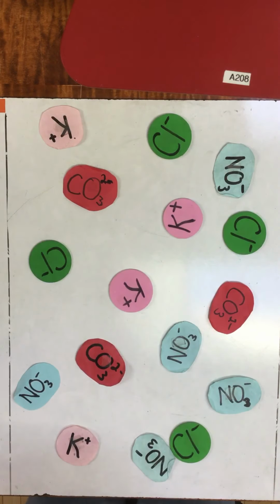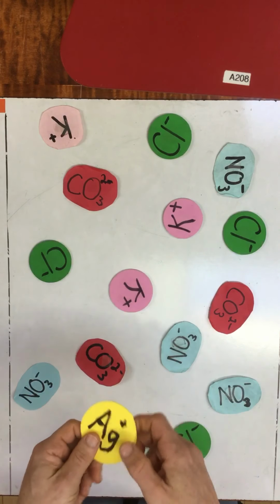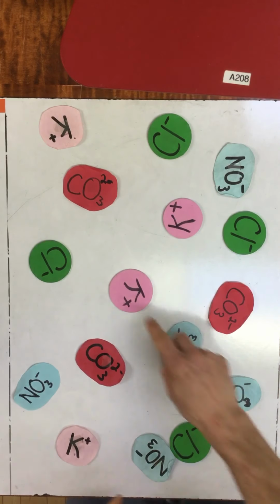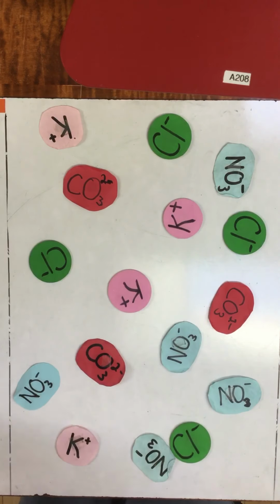So even though we added some additional ions, the chlorides and carbonates are still floating around because we can't make any precipitates. So you've seen one example that works, which was the barium ions that only make the carbonate precipitate. You saw silver not work because it precipitates with both the chloride and the carbonate. And you saw potassium not work because it doesn't precipitate with either. So that's your summary. The key is to check your solubility rules chart and find an oppositely charged ion that makes one precipitate, but not with the other ion you're trying to separate.